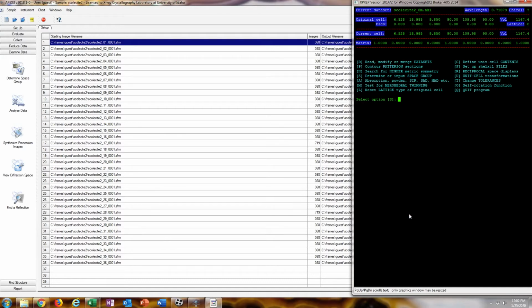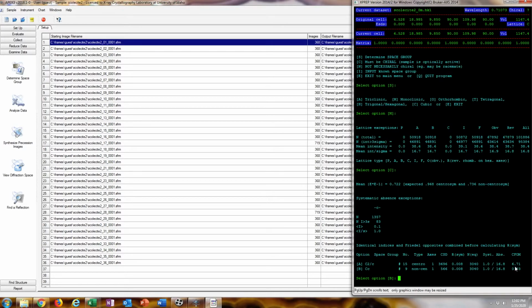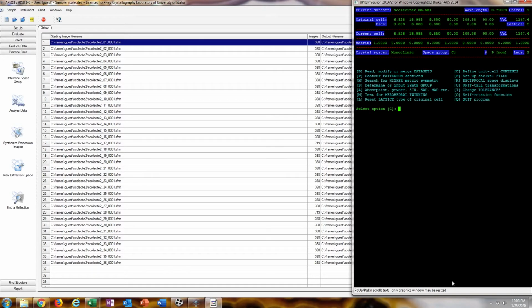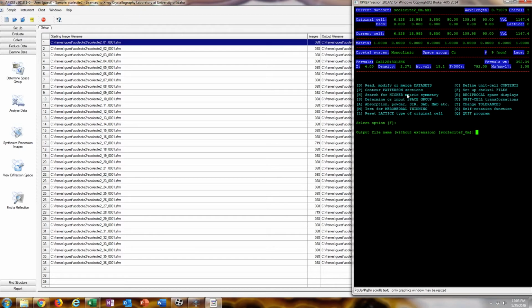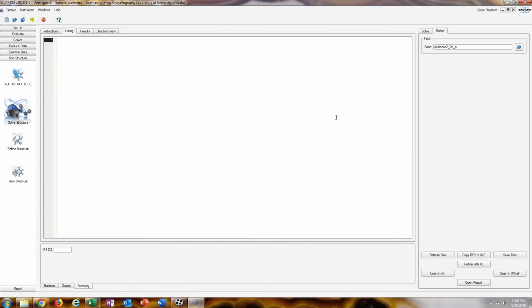There's a lot of statistics about symmetrically equivalent spots, rejected thresholds, and all this stuff. But if you have a good data set, you should be pretty much fine. Good combined figure of merit, you want that to be near 1 for the Cc space group. It needs a formula and a tentative Z. This doesn't have to be exactly correct. We're going to prepare the SHELX files and the HKL file. And then we're done with XPREP. So that went pretty smoothly, which is no surprise if you have good data and everything.